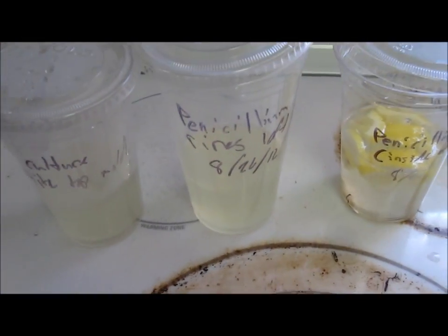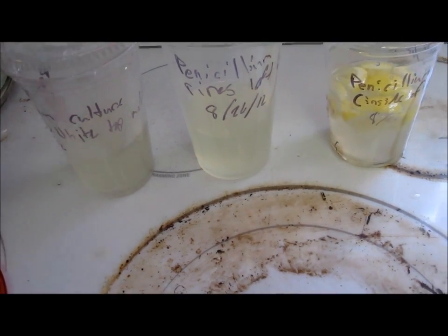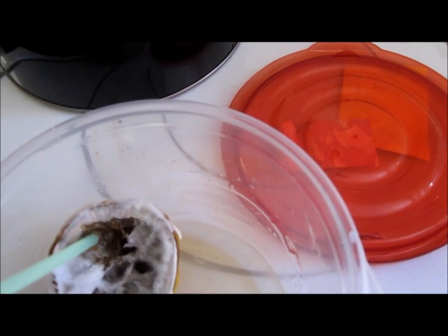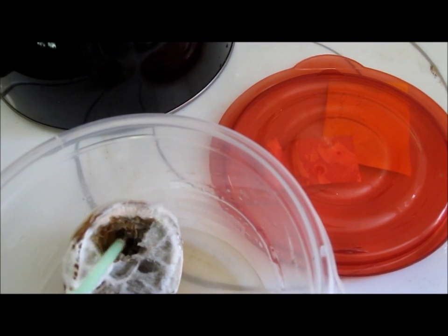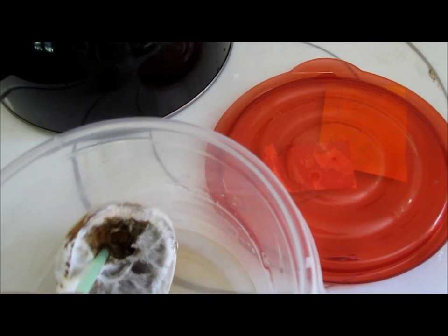I'm going to take this straw, and I've cleared a spot away, and I'm going to try and take sort of like a core sample of what's inside one of these pieces.